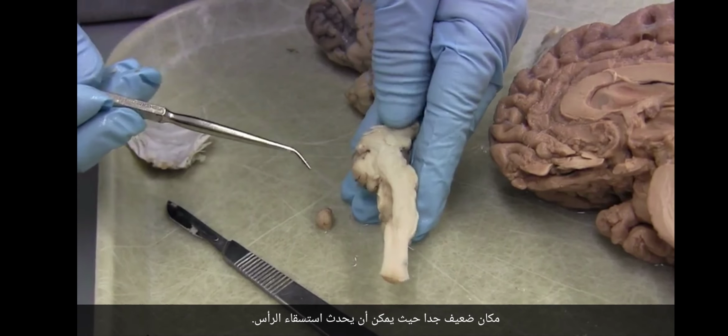Let's get some of this septum out of the way. Okay, so we can kind of see what's going on here. All right. And what you notice is that there's this smooth, smoothly lined cavity here, and that is the lateral ventricle. And then there's this crud in it, and this is the choroid plexus. This is the tissue that makes the CSF. So the CSF is just being churned out.